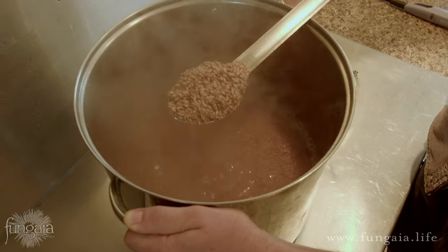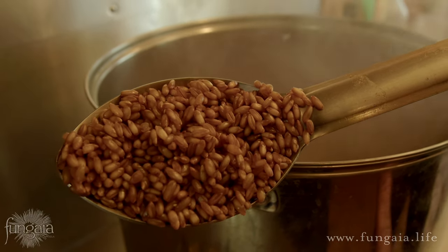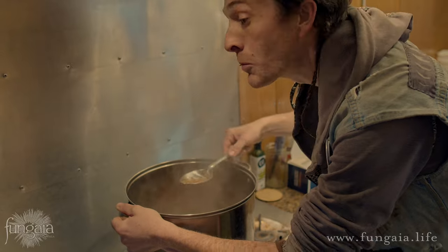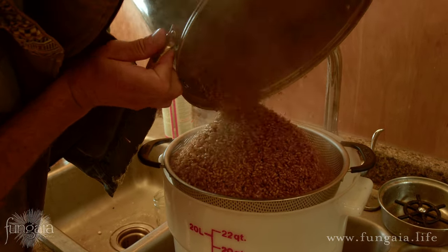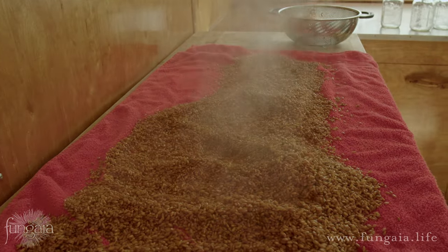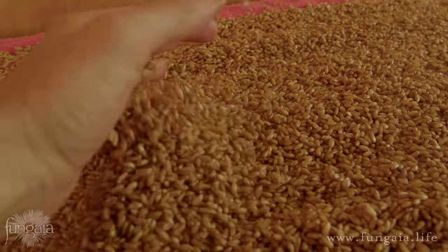Boil the grain as quickly as possible, so put it over the highest heat burner you have access to. Once it's at a full rolling boil it won't need much time — we want the grain cooked a bit like al dente pasta. If you look closely you can see the outside of the kernels is translucent but there's still a little raw, crunchy bit in the middle. Tasting it is a great way to familiarize yourself with the different cooking thresholds. As soon as it's ready, strain your grain through a pasta strainer or colander, let it drain completely, and then spread it in a thin even layer across your towel or window screen exposed to the air. The hot surface moisture on each kernel will evaporate quickly as steam, leaving a dry outer surface with plenty of moisture still trapped inside.